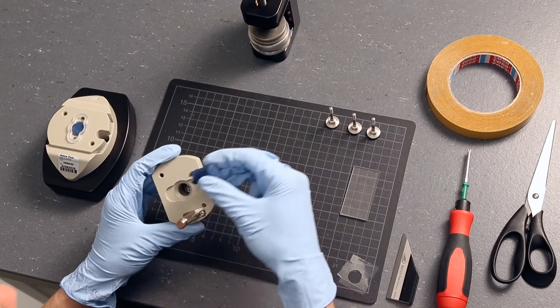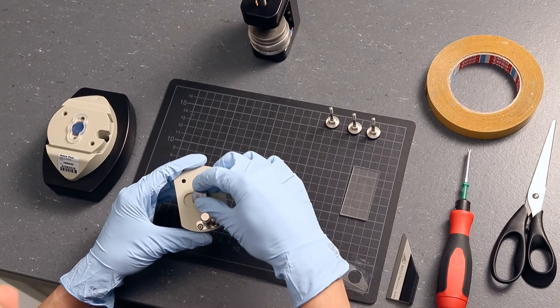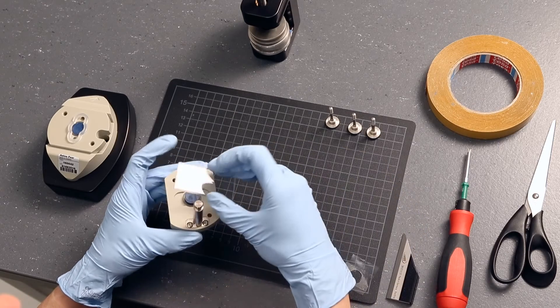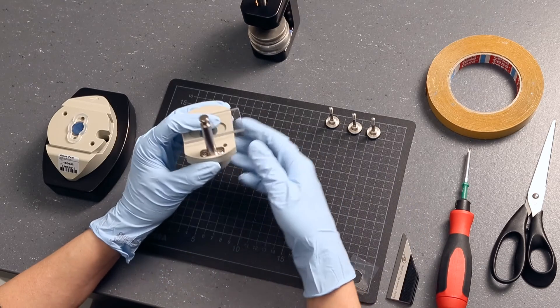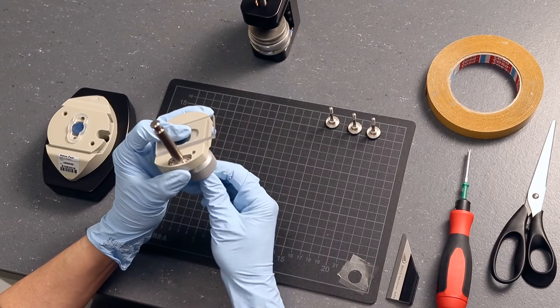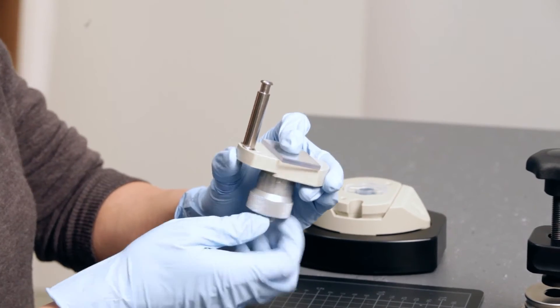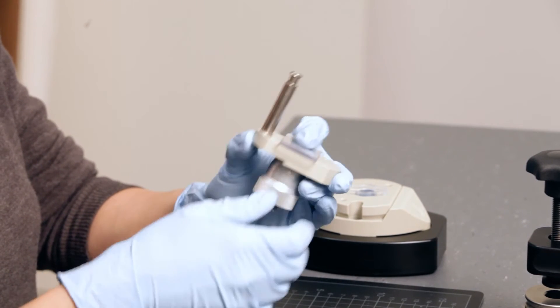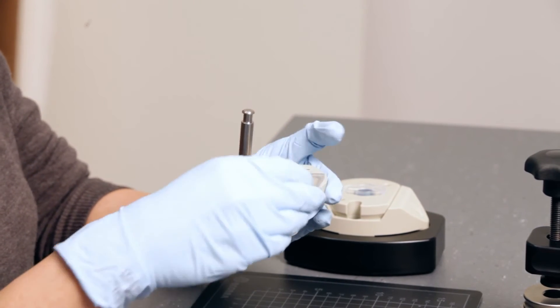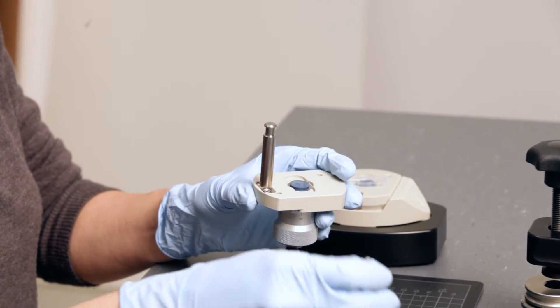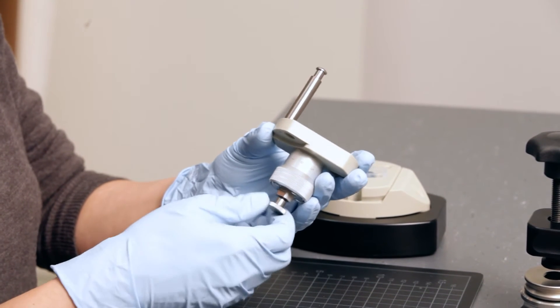Place the larger sample holder in the upper part of the cell. Use the support plate to push the sample holder in. Turn the lock at the adjustment knob until the sample holder snaps into place. Fix the holder with a screw.